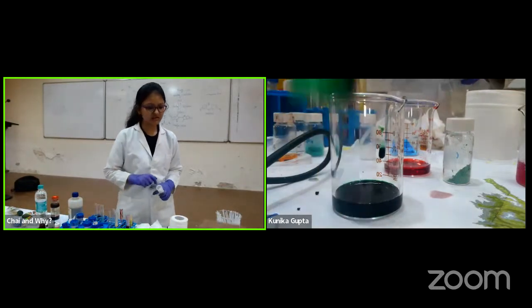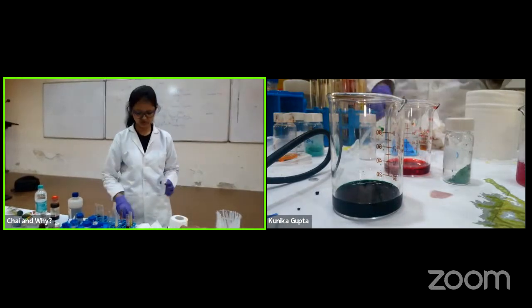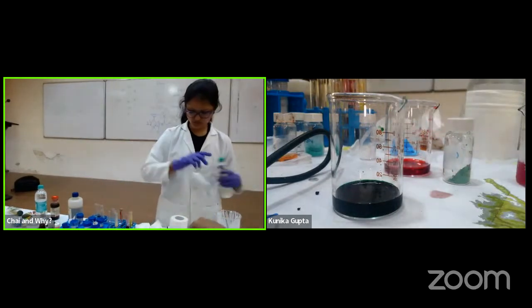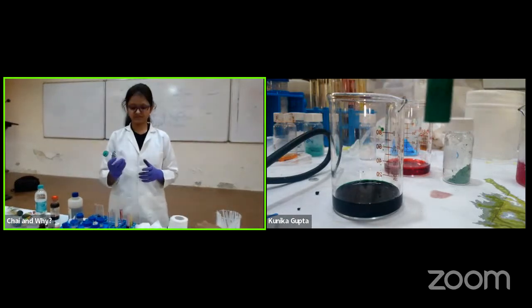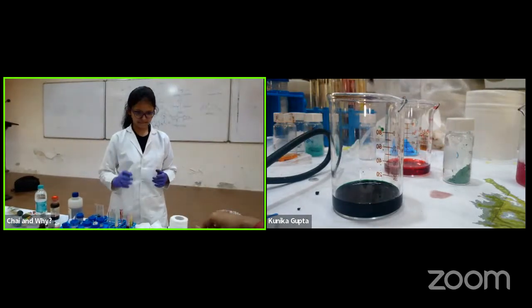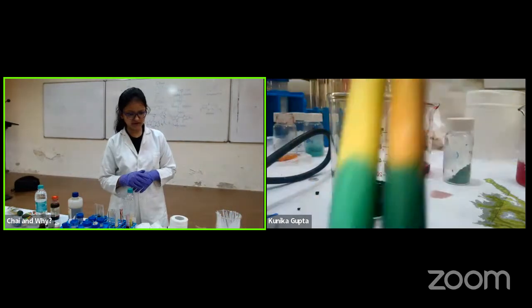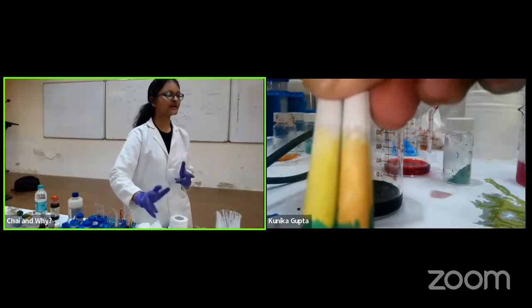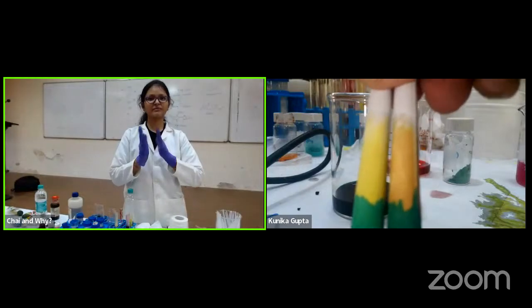So you again can see, and if we can have the old chalk, you can make out that this yellow is not that yellow which was the pure one. Where is the chalk? It's separated, right? Now I hope the difference is visible. The old chalk is actually yellow and the second one is reddish yellow, because the red and yellow almost move with a similar speed, so they just mixed up.